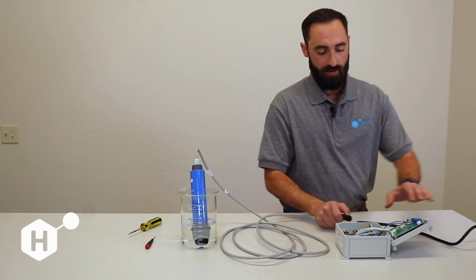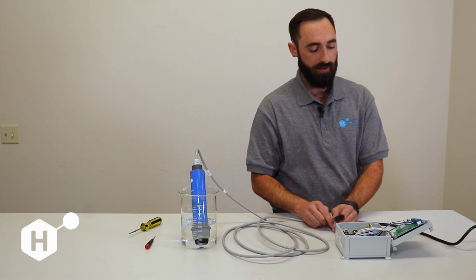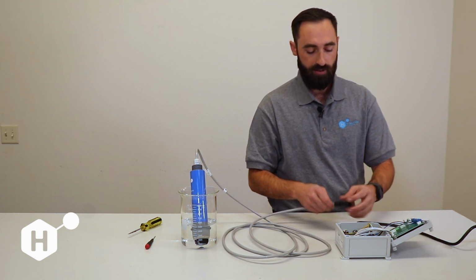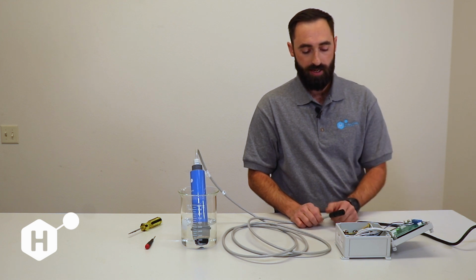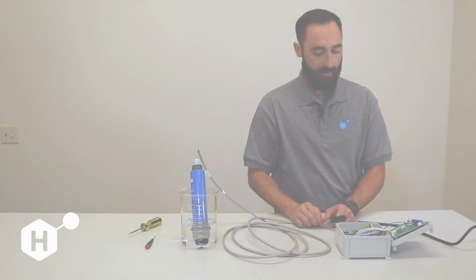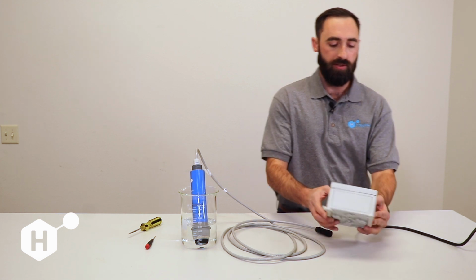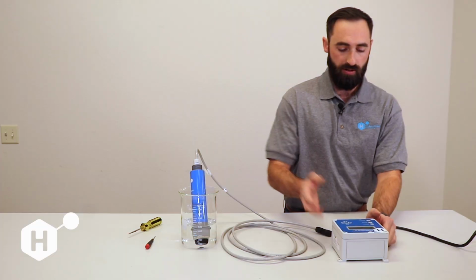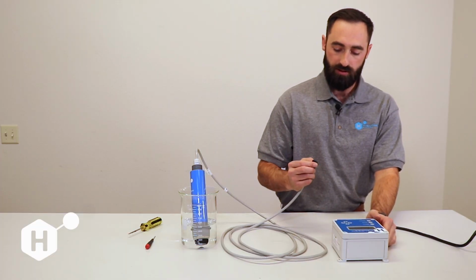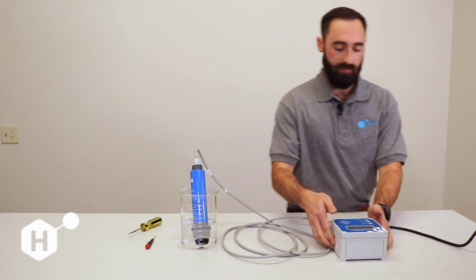If you connect now after confirming this and you're still not getting communication, then you can remove your M12 connector, remove these wires, and wire the sensor directly into the display board to rule out any damage to this M12 connector here as well. So now I'm going to show you how to establish communication when you can see address none, nothing is shown. Of course, our sensor is not connected. So we're going to go ahead and connect the sensor again. We're going to confirm that we can hear the sensor powering.